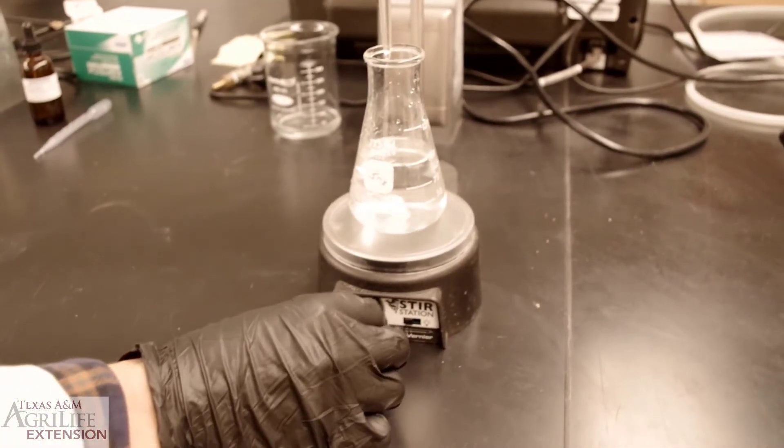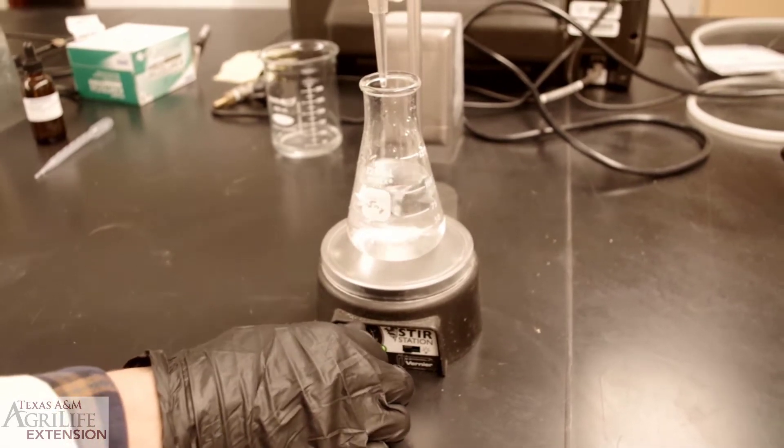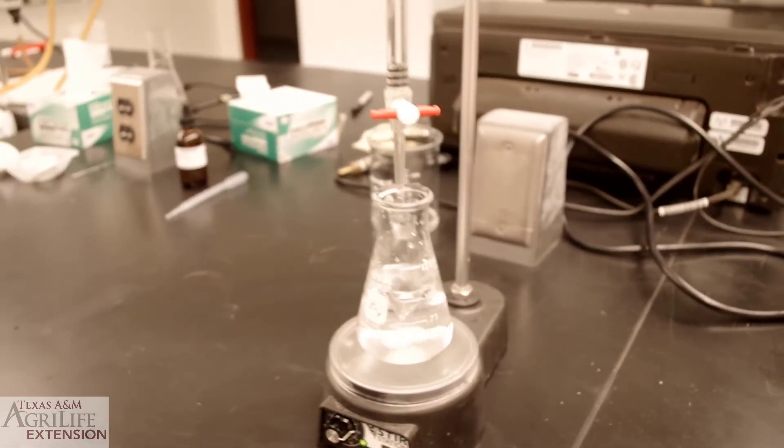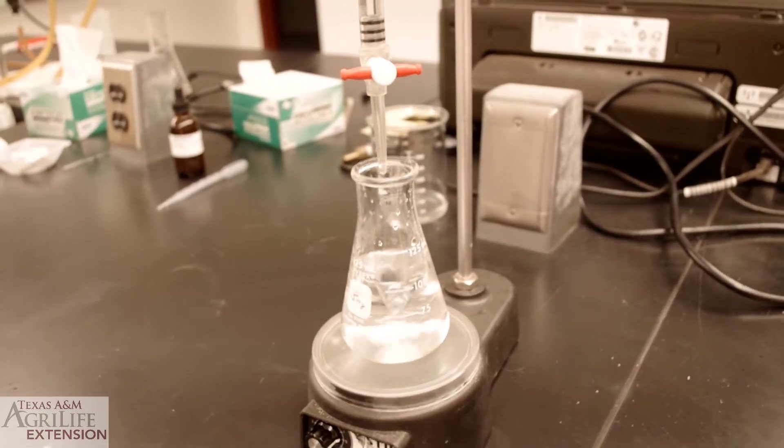You can now turn the stir plate on. You are now ready to begin your titration.